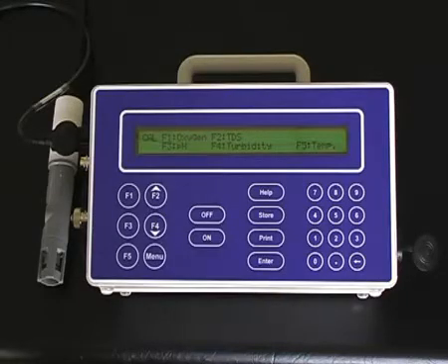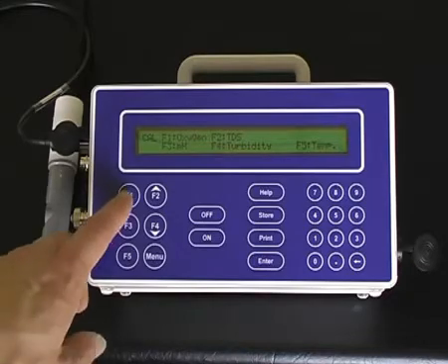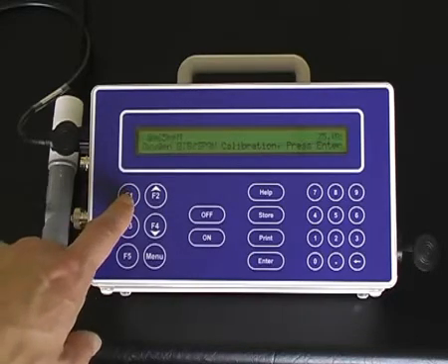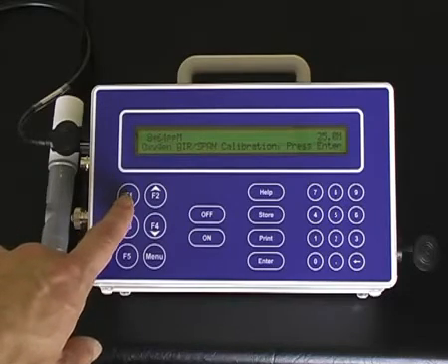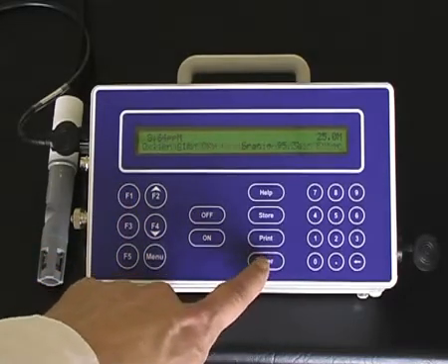Allow the dry sensor to equilibrate in air. Press F1 for oxygen. And once fully equilibrated, press enter to calibrate the second point.